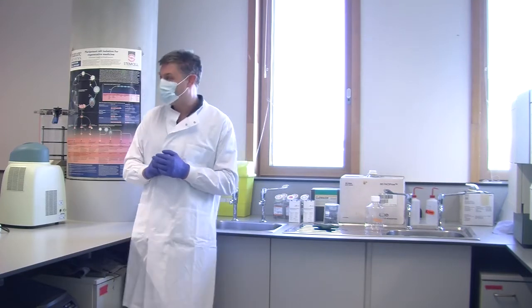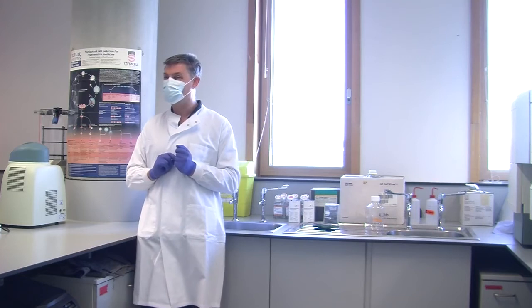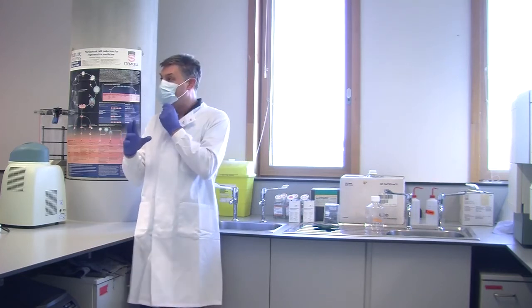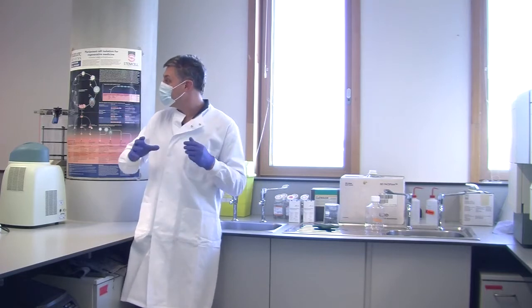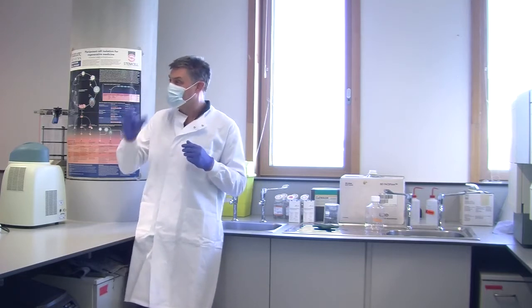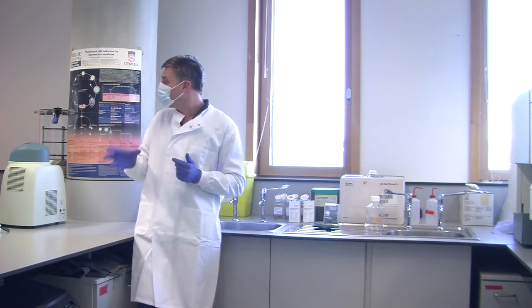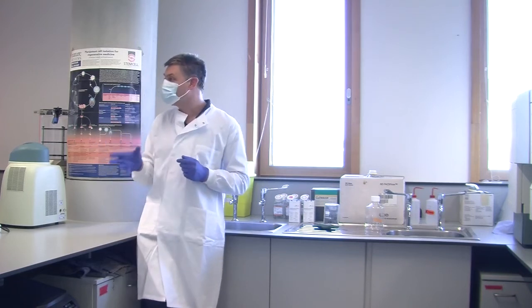Then you also get bad practice, such as a PhD student who kept leaving my antibodies on the bright windowsill. And the thing about fluorochrome is, if you hit it with daylight, it keeps fluorescing, but that wears it out. So you end up with a non-fluorescent fluorochrome. It's called photobleaching.